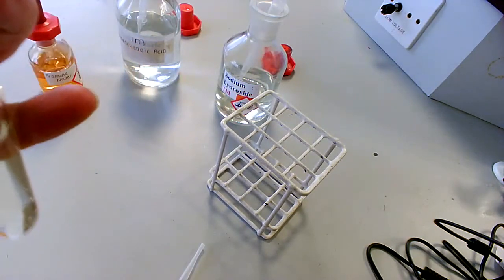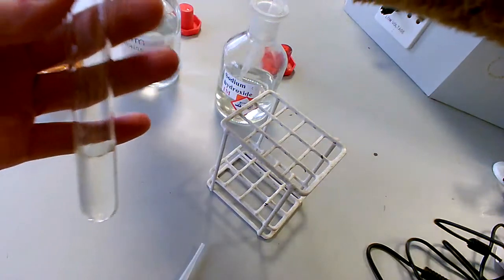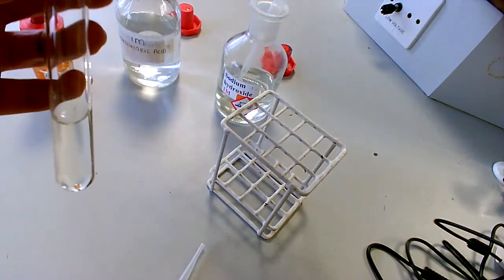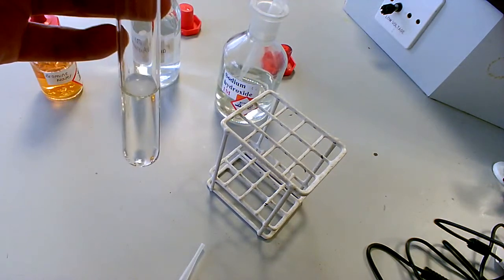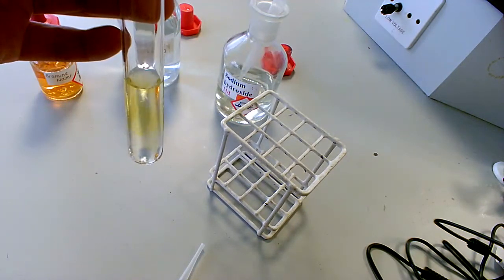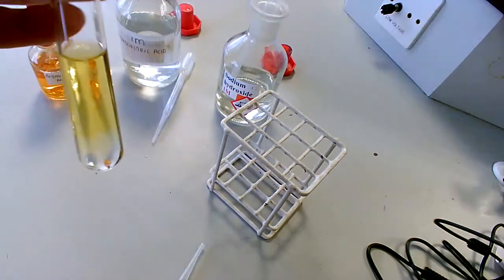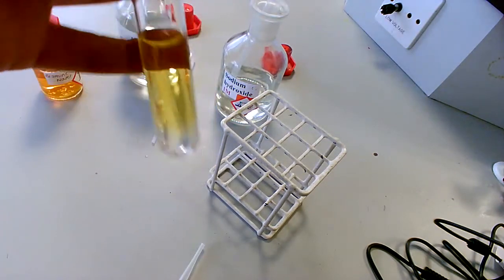So that's when I've added sodium hydroxide, and now I'm going to add hydrochloric acid, again about a centimeter cubed. And as if by magic, we have the orange color that has reappeared again.